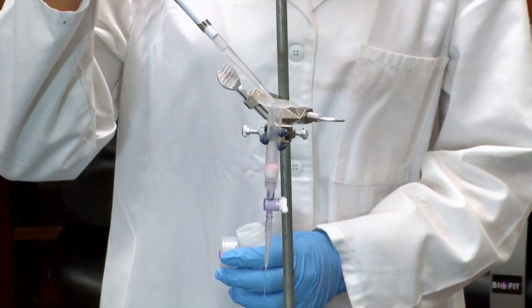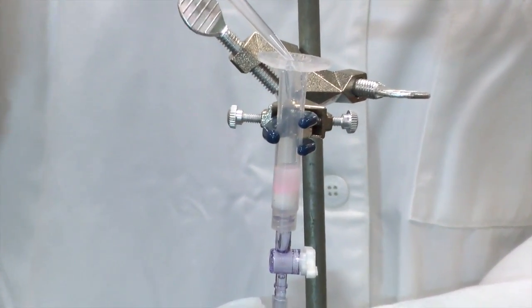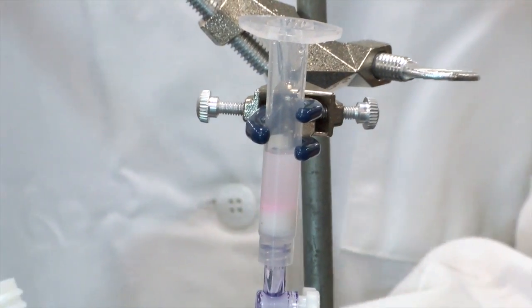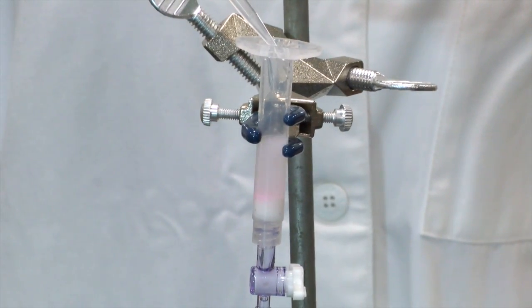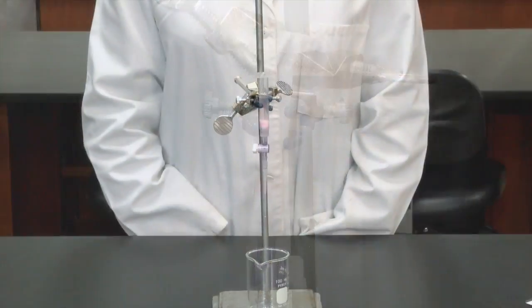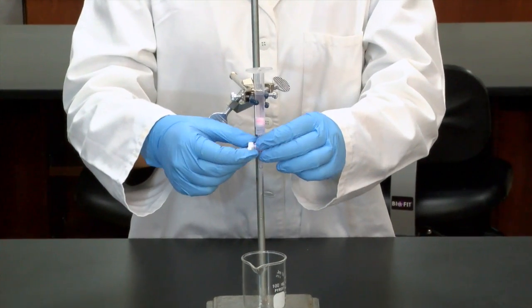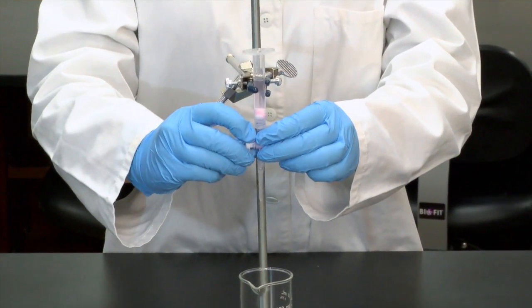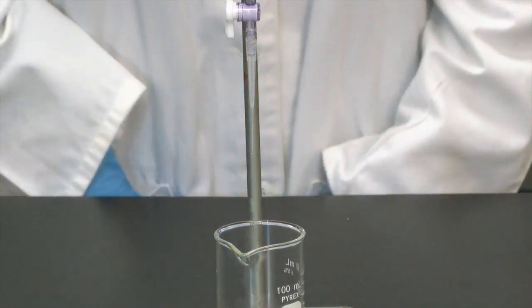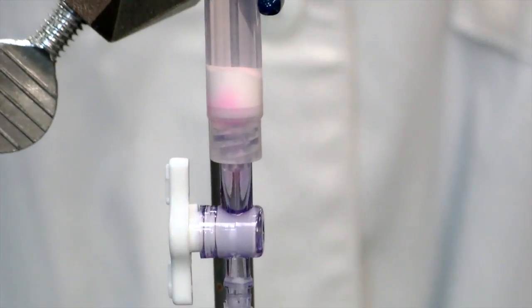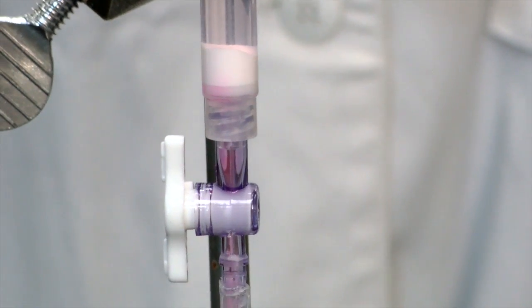The next step is to add 2 mL of elution buffer. The red fluorescent protein will be released from the column and flow down. It causes the proteins to change shape and cover up their hydrophobic areas so that they do not bind to the hydrophobic resin beads anymore. You will be collecting the pink drops into a clear microfuge tube.